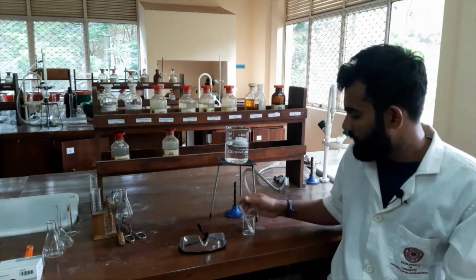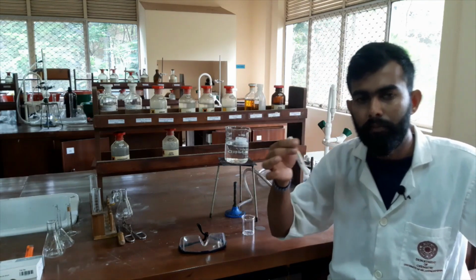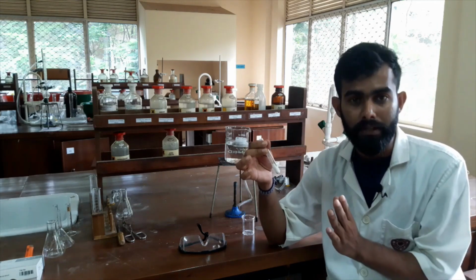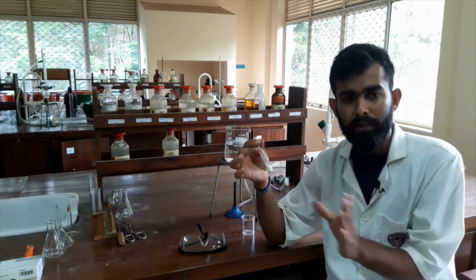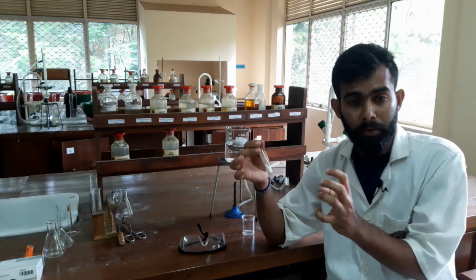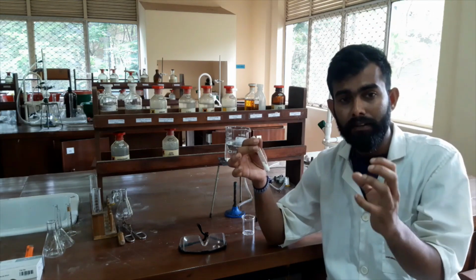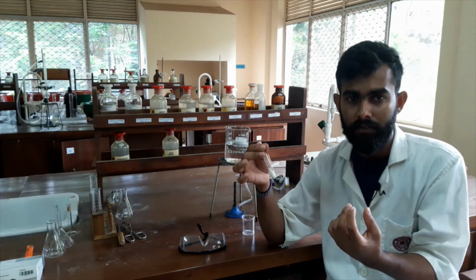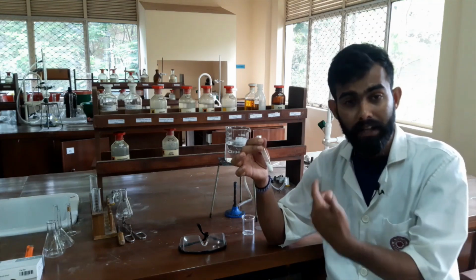Okay, you can see it's already a solid, but it also contains so many impurities. So I want to separate out this major chemical component from those impurities, and I will produce crystals from that. Other impurities will be removed by this technique.